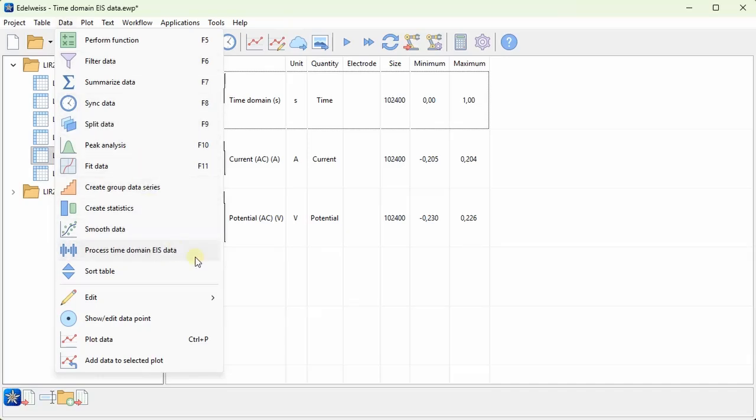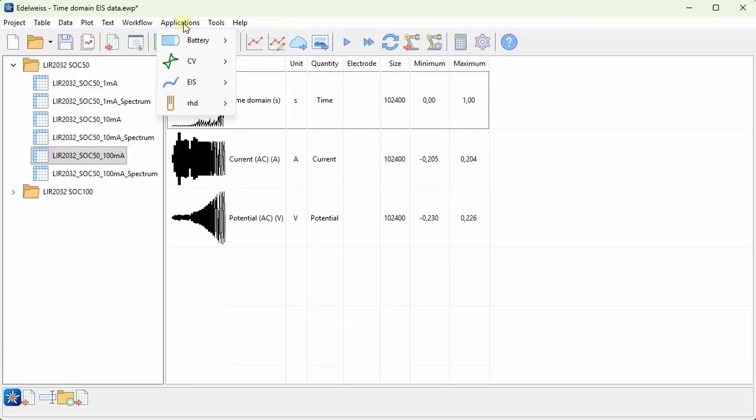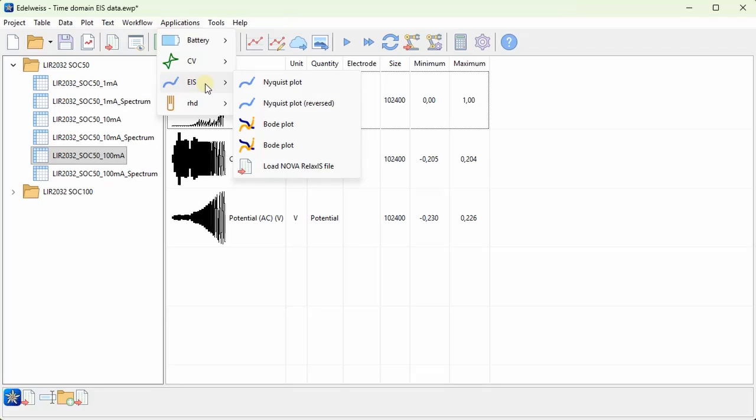and I want to start by emphasizing that we will not talk about any equivalent circuit fitting. This can be done in RelaxIS. You can find more information about RelaxIS on the RHD Instruments website, but Edelweiss does not contain any kind of modeling of impedance data, so we will not talk about it in this video. We also will not talk about the EIS applications that are built into Edelweiss, but we will just use them for plotting in this video.